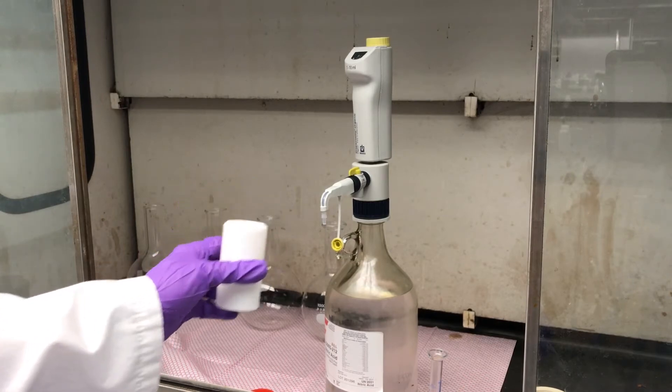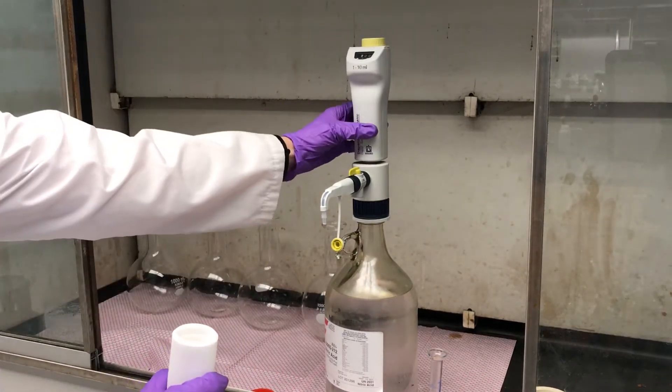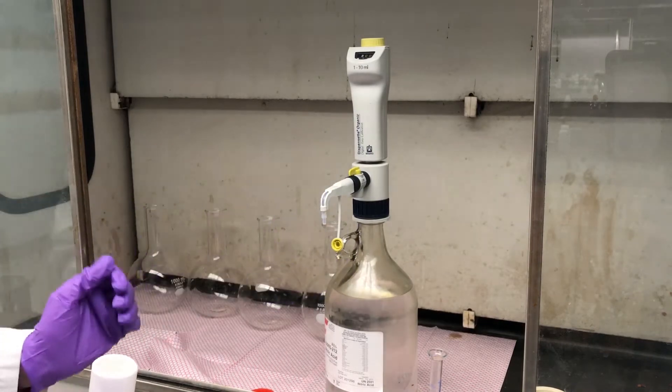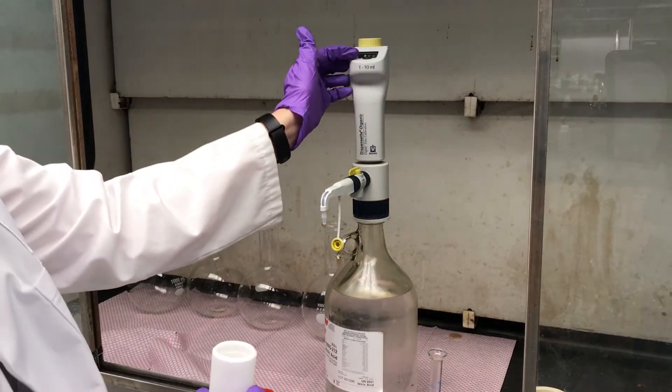We've got our soil in here and so we've got a dispenser set up for our nitric acid. It's set to deliver five milliliters.